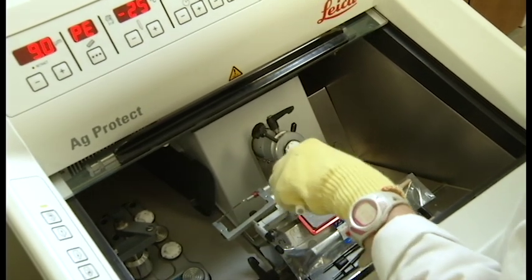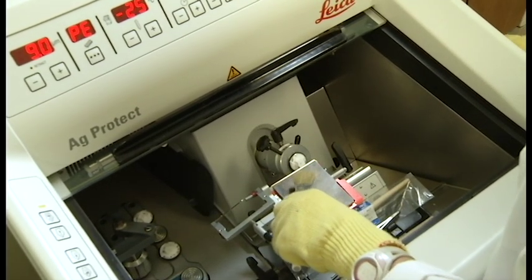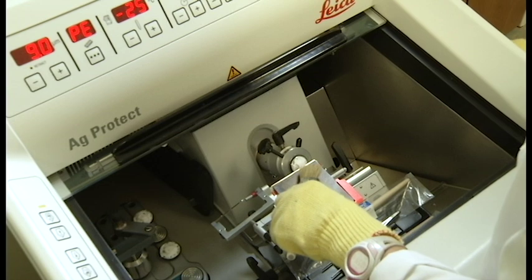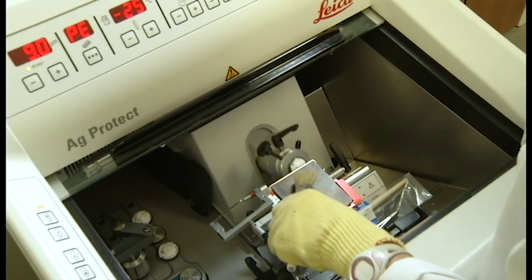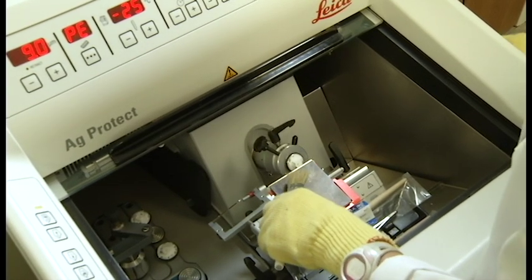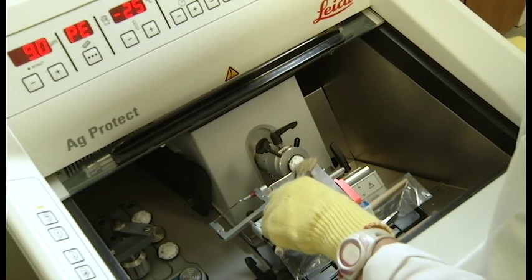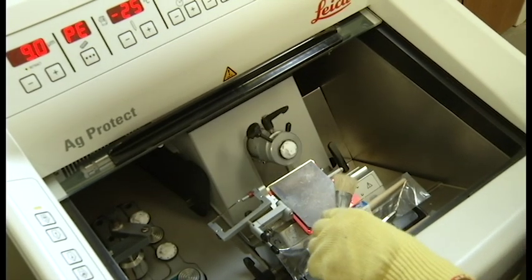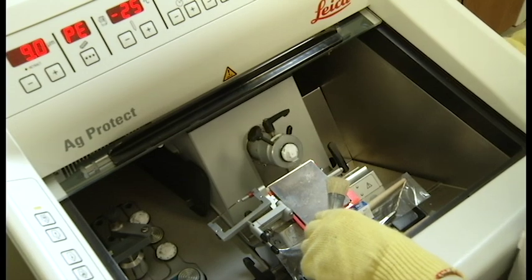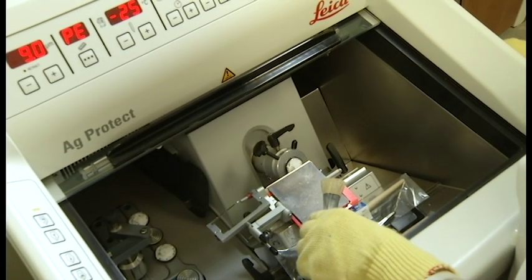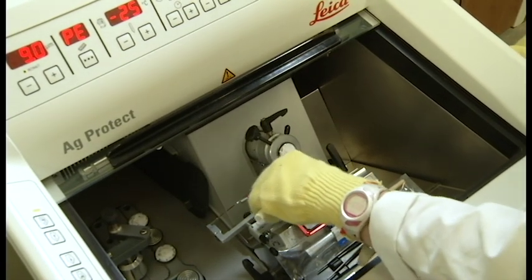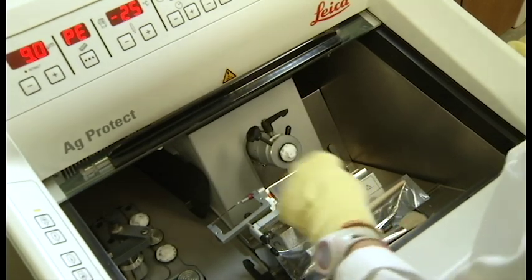Also, remember that you may or may not initially see tissue in your slices. They could initially be slices of only media if your tissue is situated deeper into the block. You can always manipulate the thickness of the slice to get deeper into the block where your tissue is located, but don't forget to change it back to a thinner slice so that your slides will stay on during the staining process.